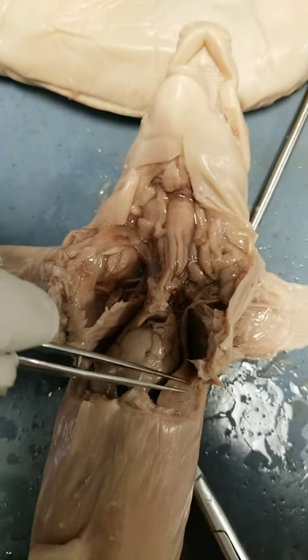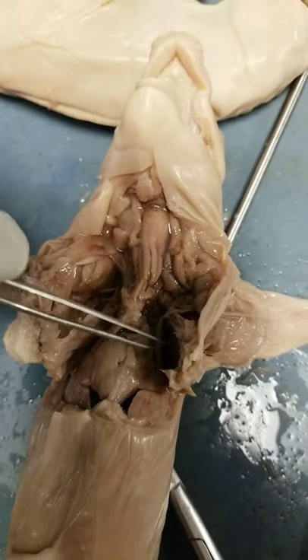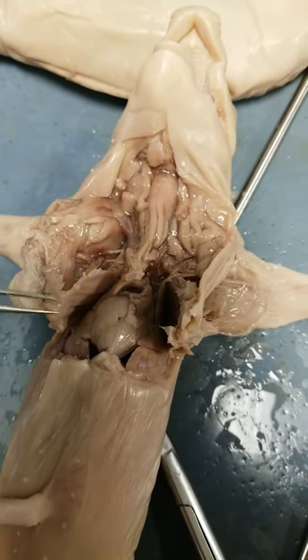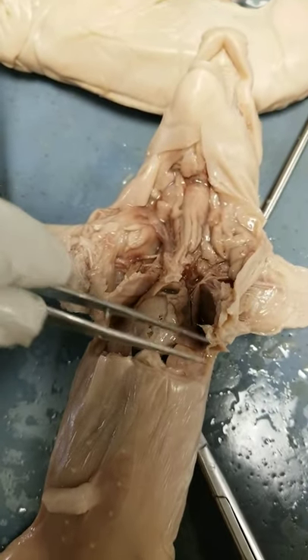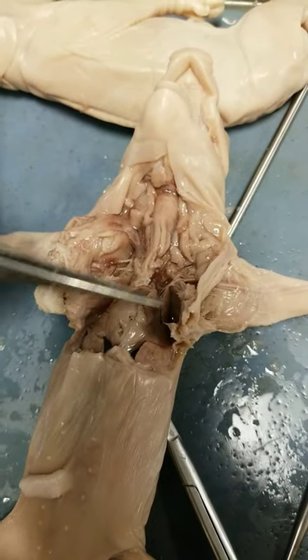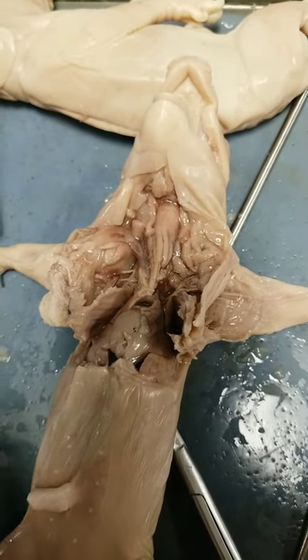The lung similarly has a membrane surrounding it — what's surrounding the lung is the pleural membrane. The heart resides in the pericardial cavity, which is in the mediastinum. The lungs reside in the pleural cavity. Both the pericardial cavity, mediastinum, and the pleural cavity are all within the thoracic cavity.